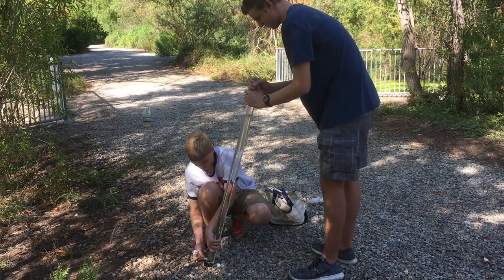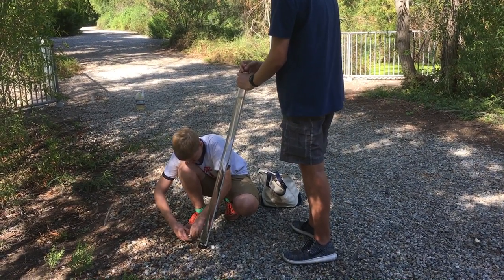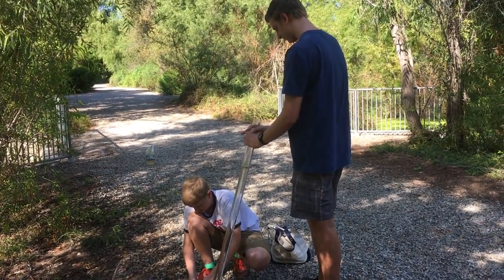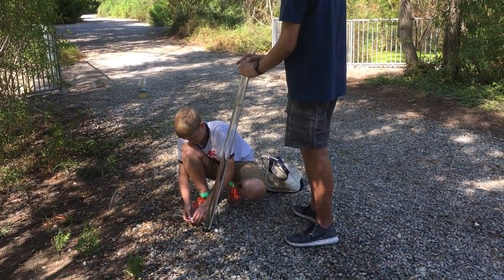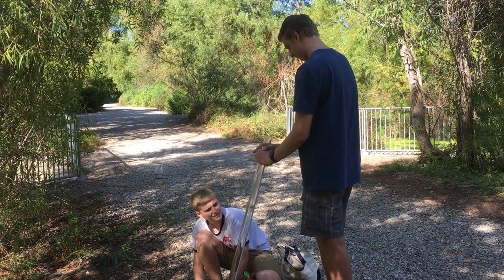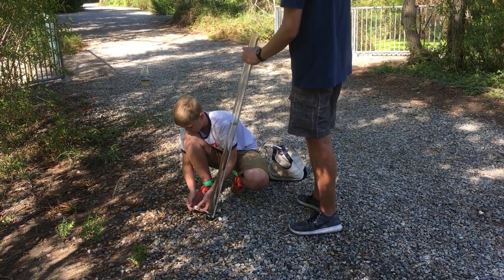Okay, it's a valve — there you go. When Robbie says it's clear, Peter, you stop. When the Secchi disc is clear, Rob, you say stop and Peter will stop.